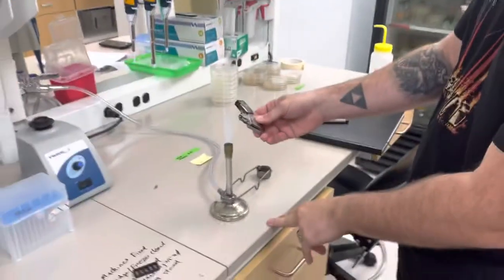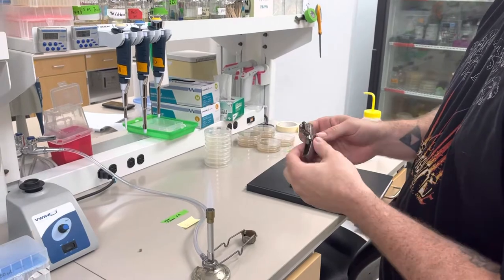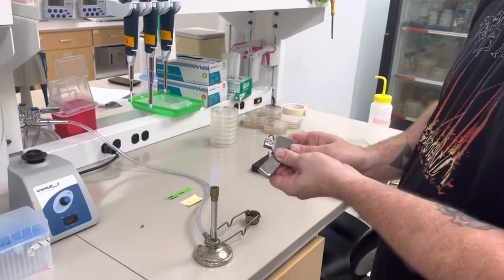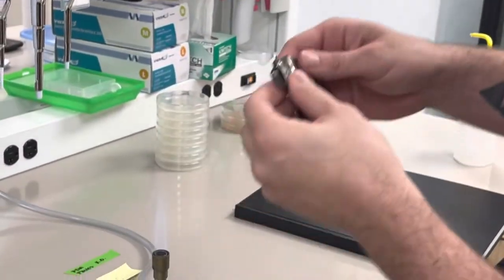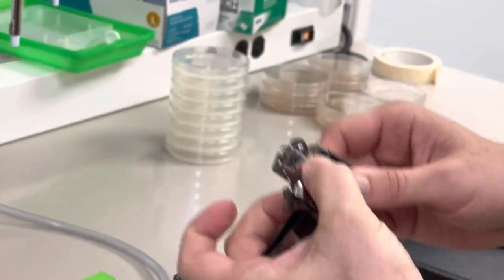You have to keep in mind, guess what? The zippo lighters also have flint, and the flint is also a consumable. It goes away. So if you have a zippo lighter that you try to strike and you don't see a spark, there's no flint.